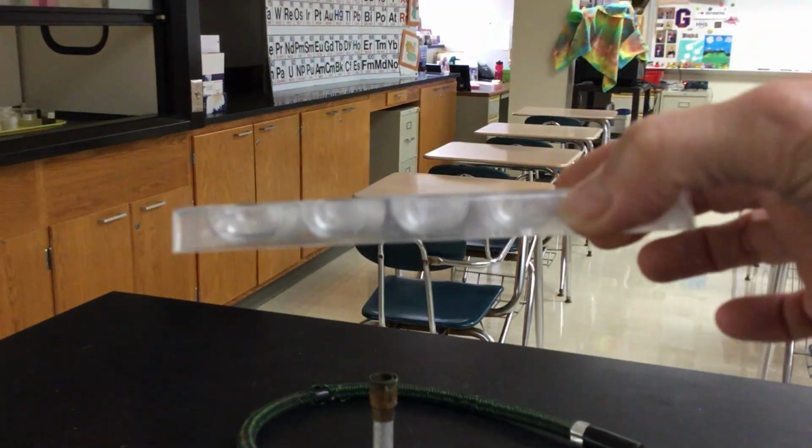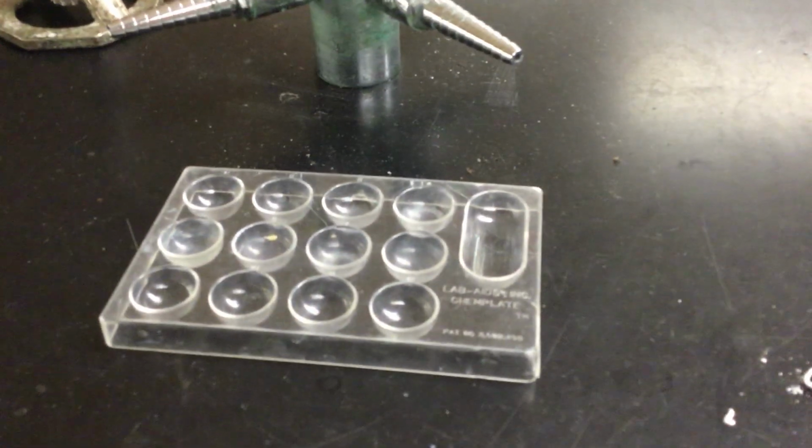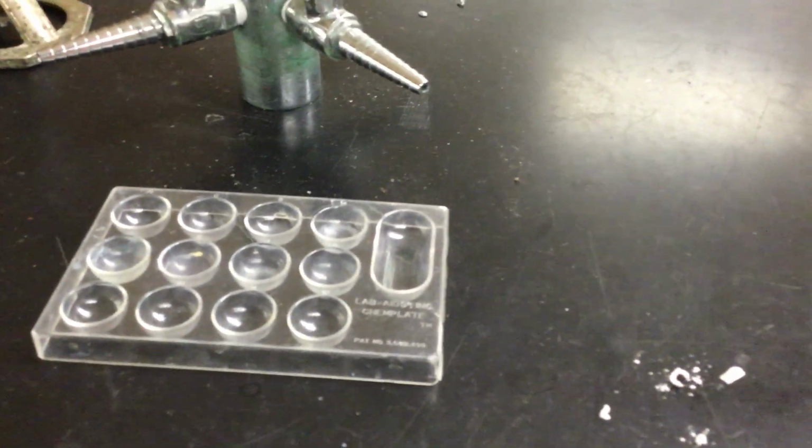It's called a well plate or a test plate. So there are these individual little areas on this where you can do reactions. Okay, so there is an empty one. And then what I did in part 3 was I put magnesium chloride in one of the wells, calcium chloride in the next one, strontium chloride, and then barium chloride. To all 4 of those, I added sodium carbonate.